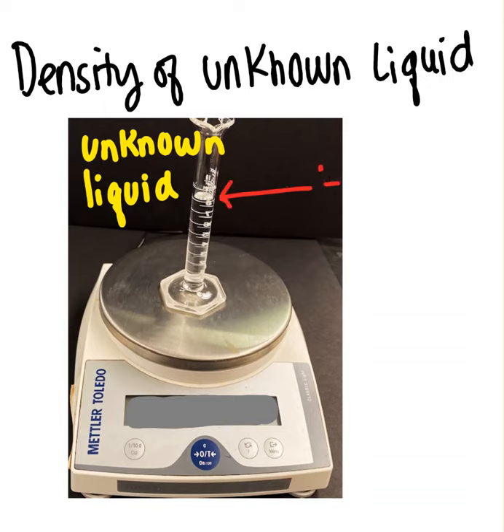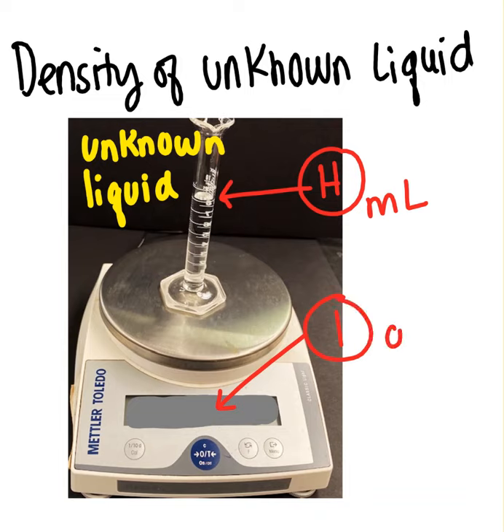Its volume is data point H, and that is in milliliters. Its mass that we measure off our balance is going to be our data point I, and that is measured, of course, in grams. And this is a capital I. Okay, and with that data, you can determine the density of your unknown liquid.